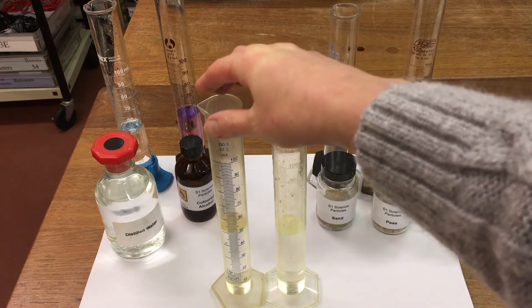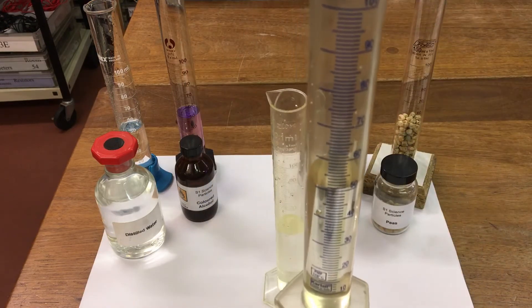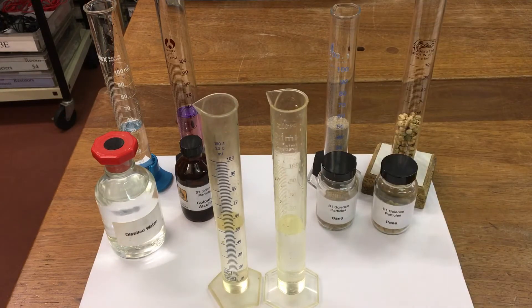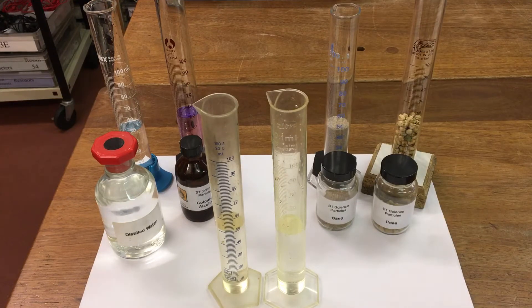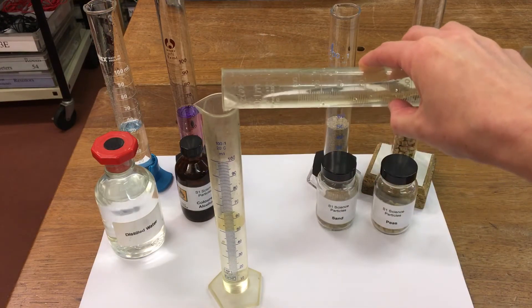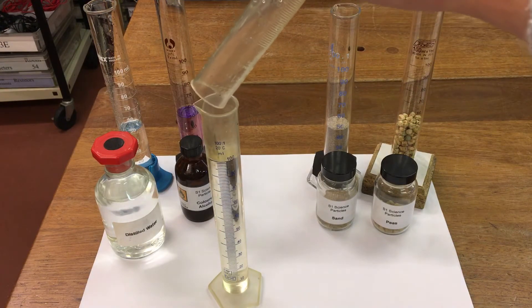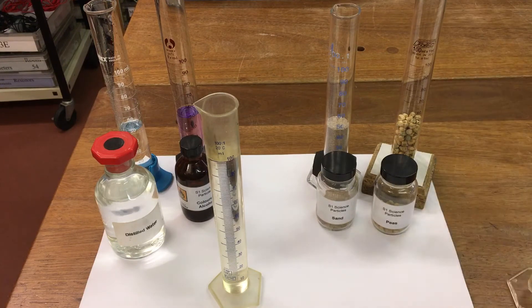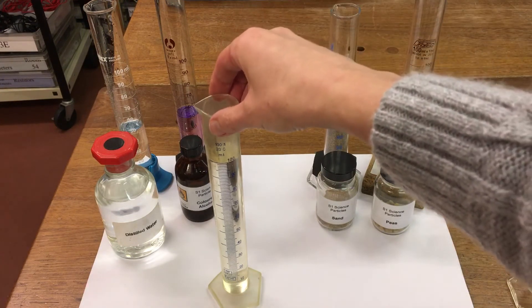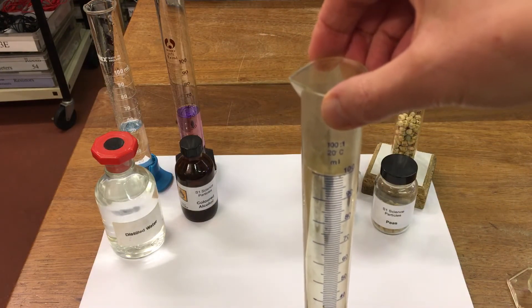We've got two measuring cylinders, each with 50 ml of water. We're going to look at what happens when we add the two measuring cylinders together. So 50 ml of water added to 50 ml of water and we've got exactly 100 ml of water in the measuring cylinder.